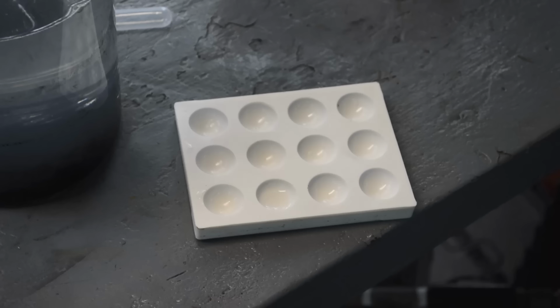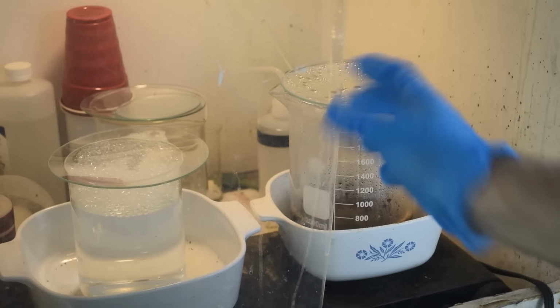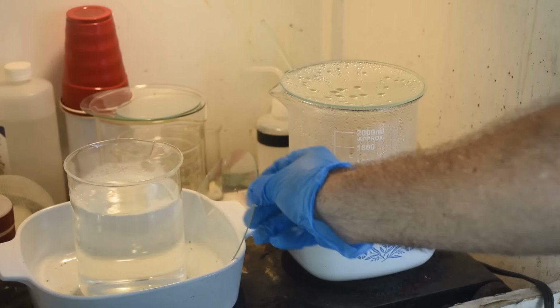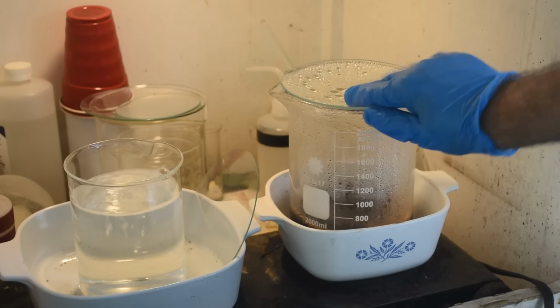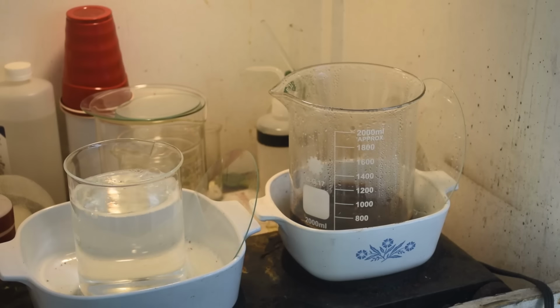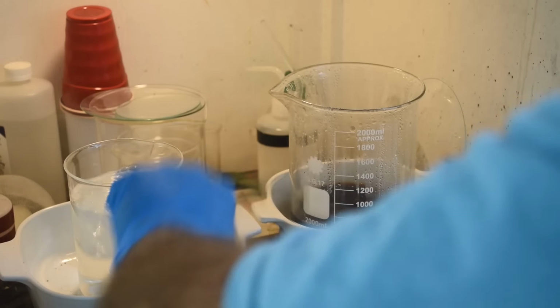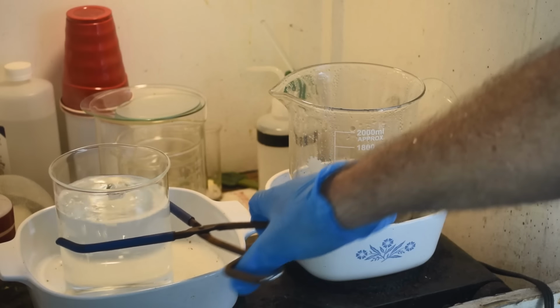All right, let's see if this stuff in the fume hood's warmed up any. All right, these are both boiling. This one's about to boil over. Get out of there. Prevent that from happening. Okay. These are a little hotter than last time. Hopefully, that's not going to lead to any kind of problem.